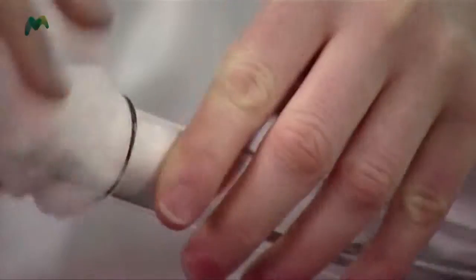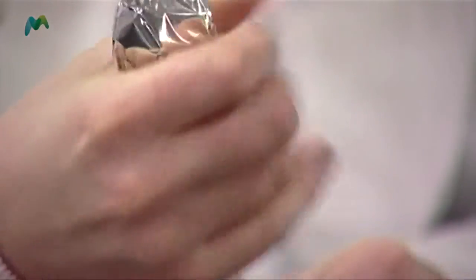It's a little bit tight, so I think what we'll do is exactly what I did — we'll take a little piece off. Just twist it as you go, and that will — yeah, it tightens on itself as you twist it. That's great. And then the foil on the top, and that's ready for autoclaving.